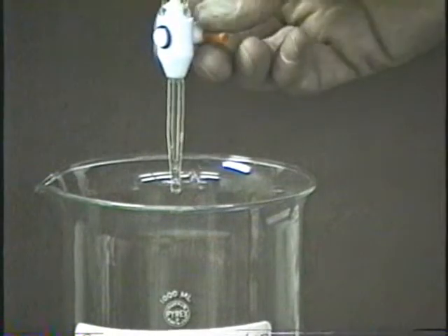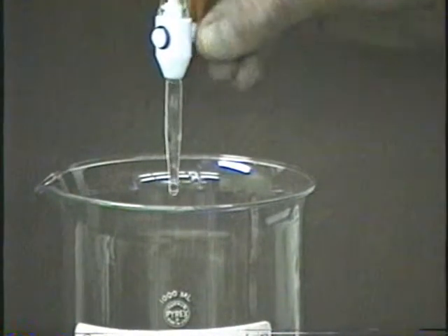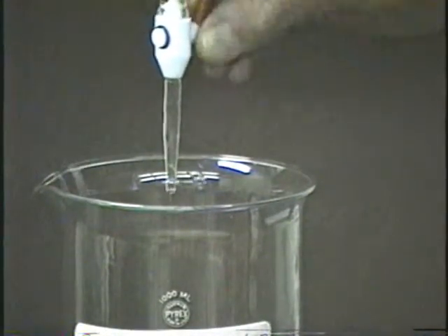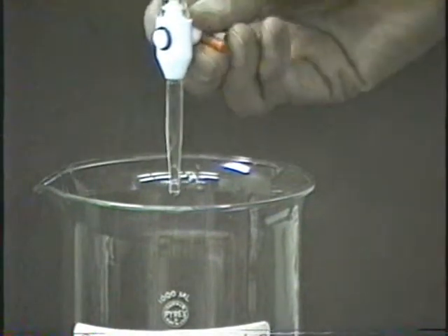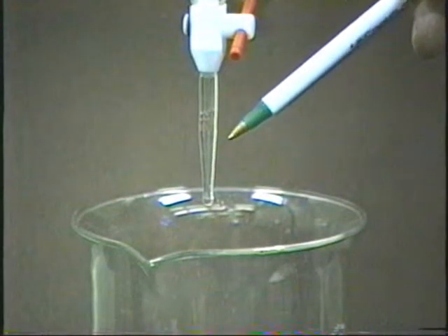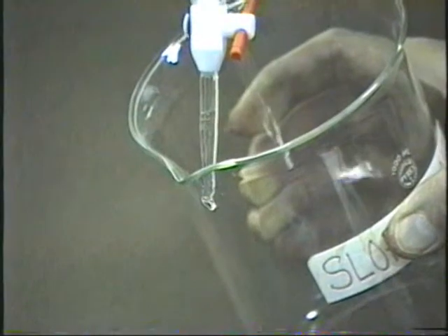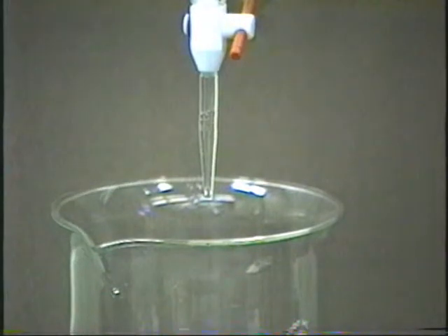All right, here's the tip. Now what you do is just turn this on and off a couple of times. You can see as we're turning it on and off, there are little bubbles coming down, and now that the bubbles are gone, we're all set. And we'll touch the tip of this burette to the slop bucket or some other place to get that drop that's hanging off the tip. And now we'll read the 0 mark on the burette.